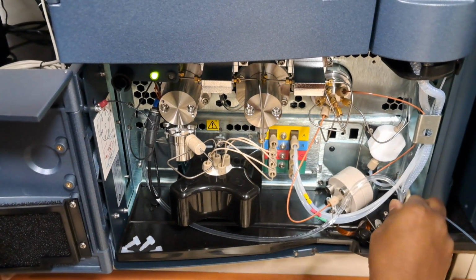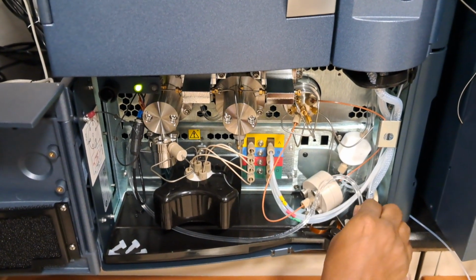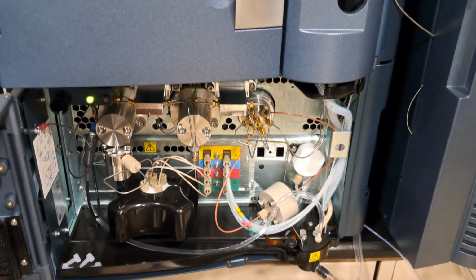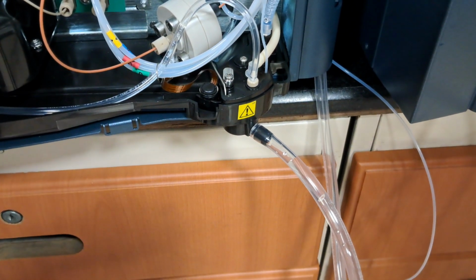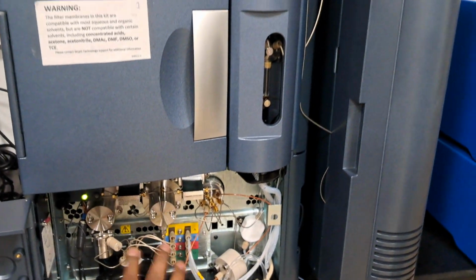Or else if you have any doubt, you can just open it. Pull it up, but maybe they may tend to break it. Let's leave it actually. The sound is coming, then there will be a flow actually. Just ensure the flow is coming here. No need of removing connections. Just let it go for 5 minutes or something. The very first step.